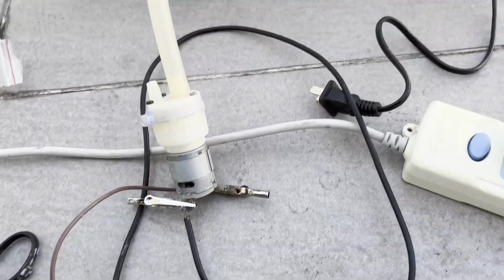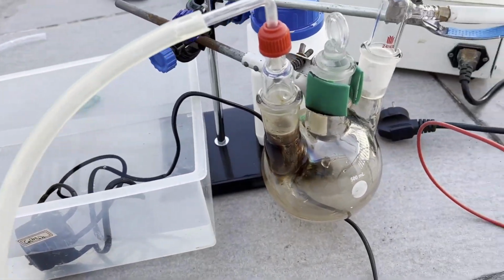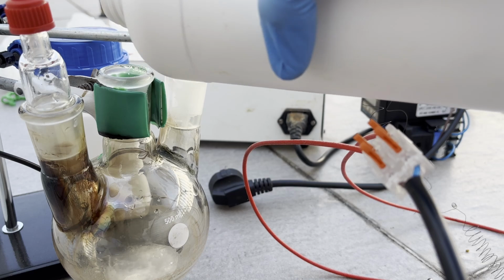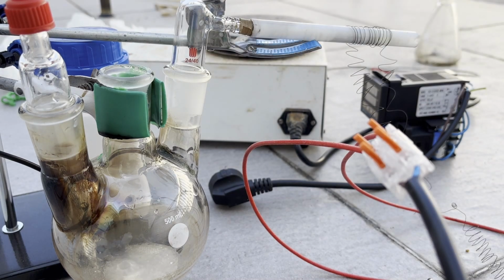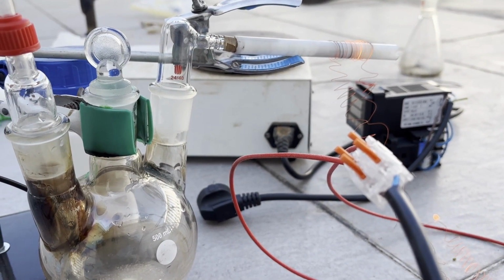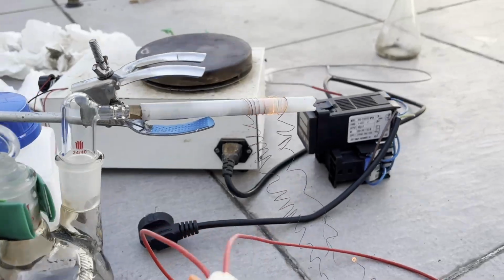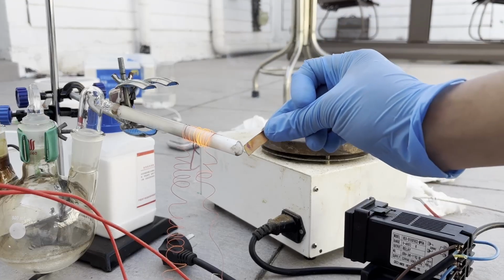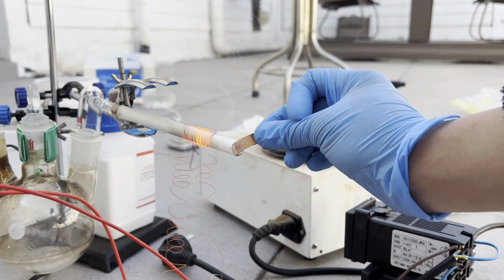and the catalyst is ready. Meanwhile, the setup consisting of a pump and a 3-neck flask was constructed, and I generated sulfur dioxide by mixing sulfuric acid with sodium metabisulfite. I turned the pump on, and after a few seconds of feeding, a thin white fume appeared at the end of the quartz tube. I tested this fume using a pH paper, and the paper turned black as it carbonized.